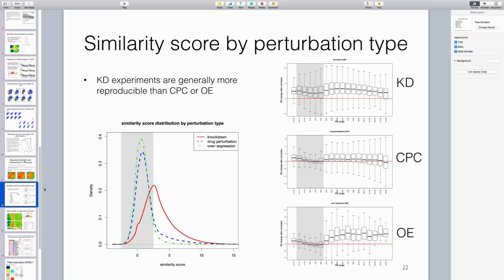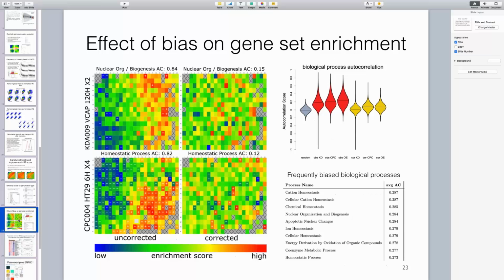So the question is, is this really that relevant to downstream analysis? If you do enrichment analysis on the signatures that you derive from this z-score transformation, enrichment algorithms like gene set enrichment are actually quite sensitive to these biases. So if we look at this, this is just taking 2 example plates, randomly selected. Then there are 2 biological processes that we look at. If there is a plus, it's a significant upregulation, and if there's a minus, it's a significant downregulation of the biological process.